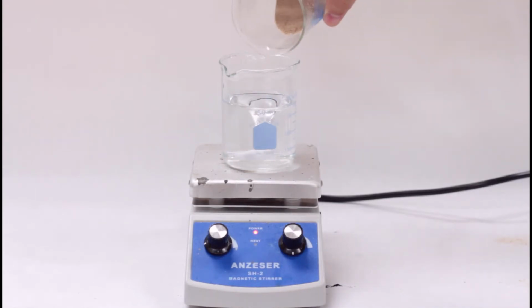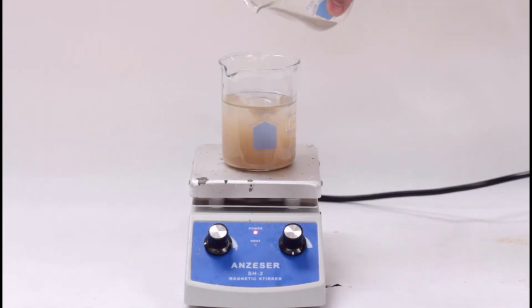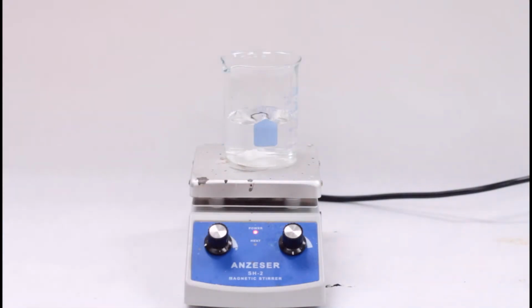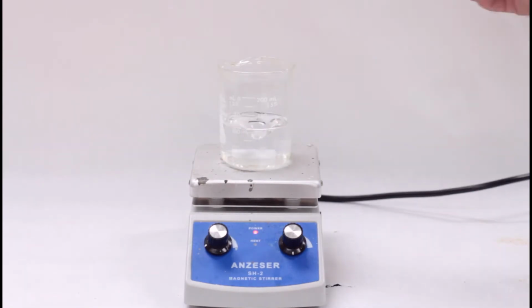In this lab, we'll be learning about the different types of mixtures that we may encounter in chemistry. For the lab report, you'll define each solution as one of the types of mixtures that we can encounter. Those are a solution, a colloid, a suspension, or an emulsion. And you'll see at least one example of each of those in this lab.